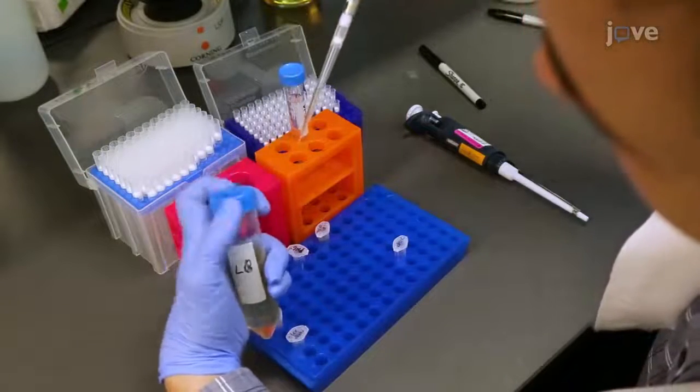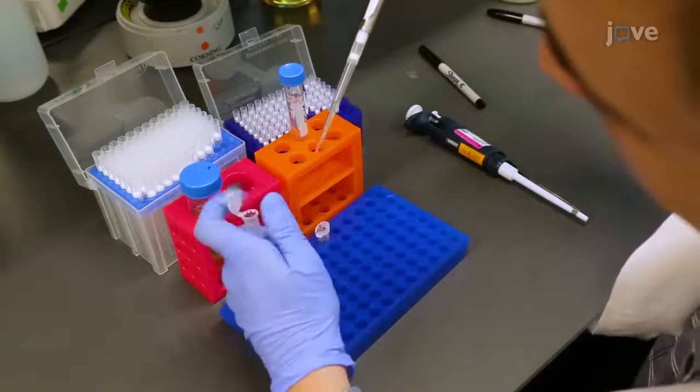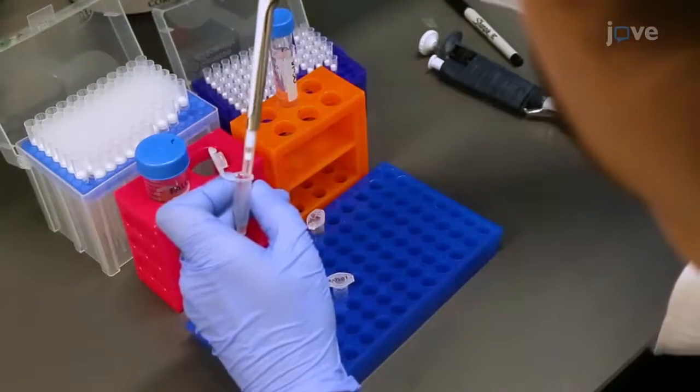Then prepare 500 microliters of LB 10% LEV by mixing 450 microliters of LB media and 50 microliters of LEV.